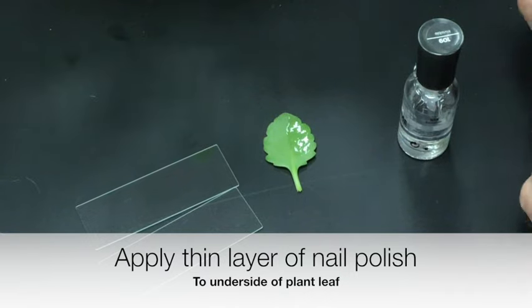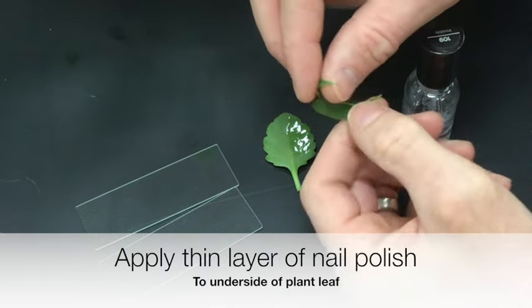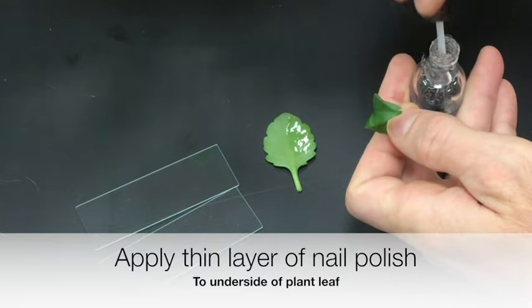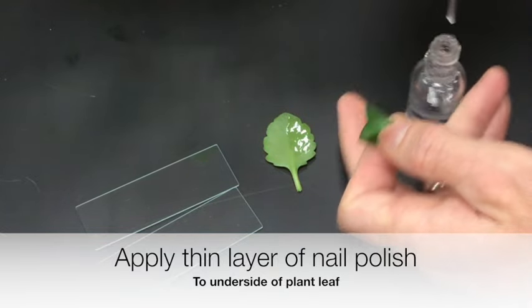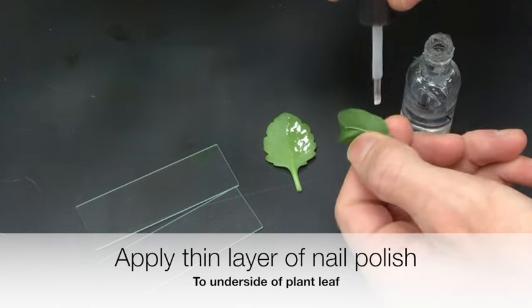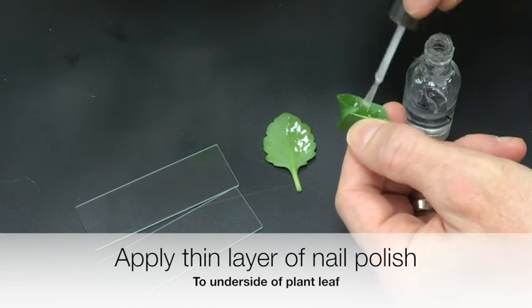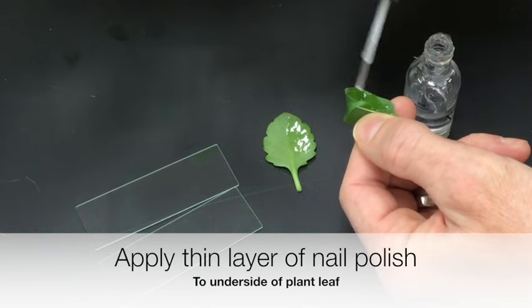And then I'll do the same thing with the ficus, just painting a thin layer along the edge, or along one side of it. And I'm using the underside of this one too.